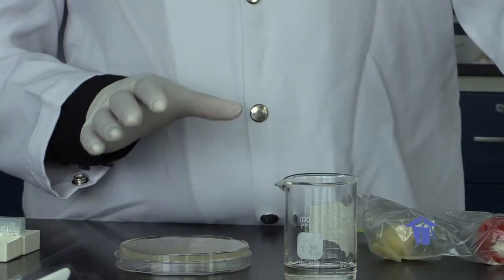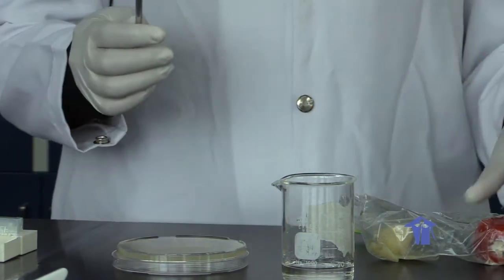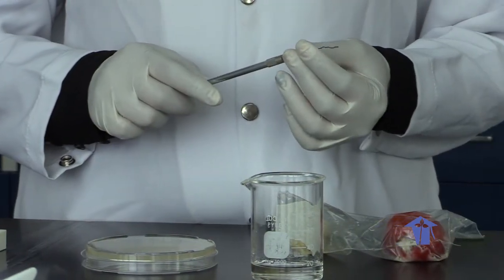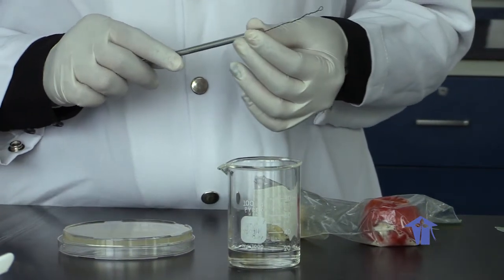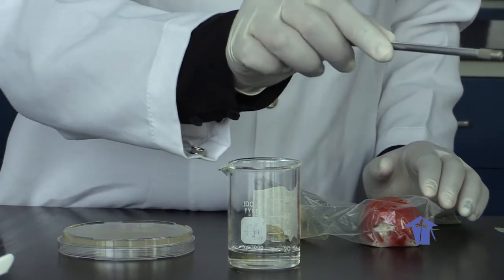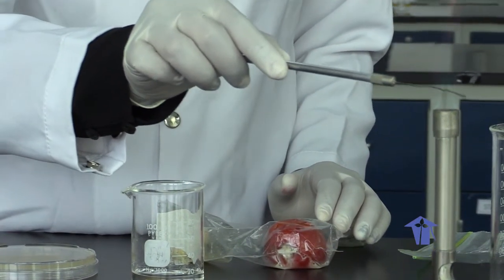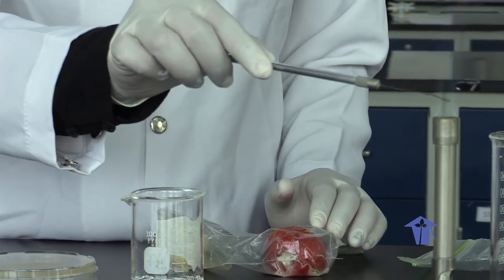So again, we have our inoculating loop. We are using aseptic technique to take a sample of this diseased tomato and do a quadrant streak, which we will be looking at in 24 to 48 hours for the growth of our pure cultures, doing a gram stain and looking at the morphology of that organism or the characteristics of that organism. So following our first lab, same procedure where we are getting our sample and doing a quadrant streak.